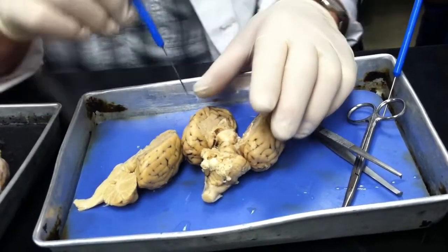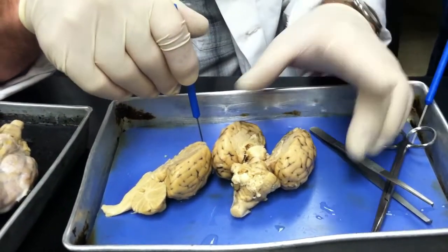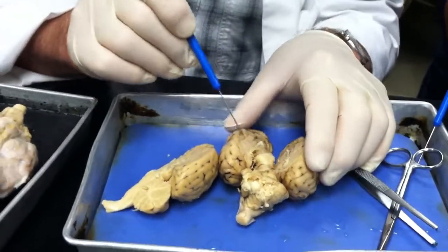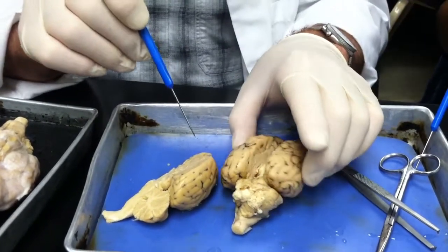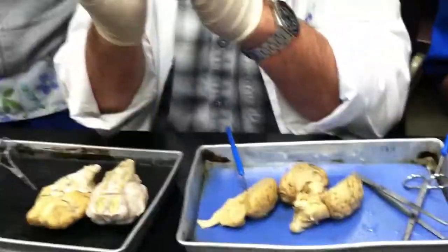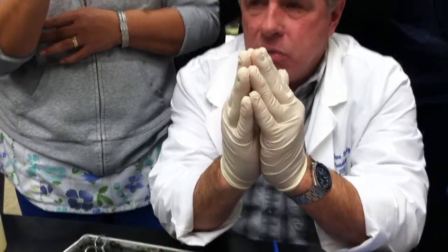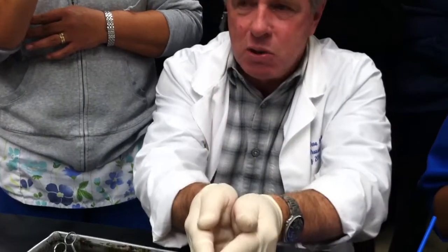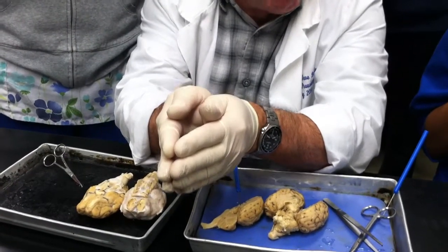So, the third ventricle. That's the one that's kind of hard to describe to you guys. This is the thalamus, and this is the thalamus over there. If we pull these two things together, so let's do it this way: my right hand is one wall, the thalamus, and my left hand is the thalamus, and we put the brain together and it looks like this. So my thalamuses have a space in between. That space in between is the third ventricle. So the third ventricle is formed by the walls of the thalamus.